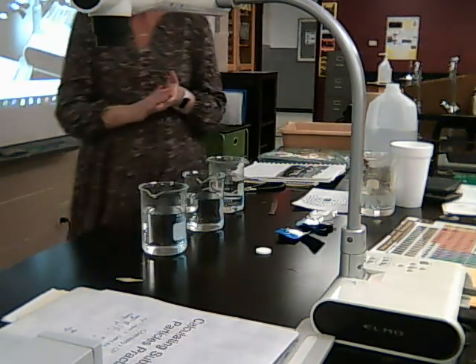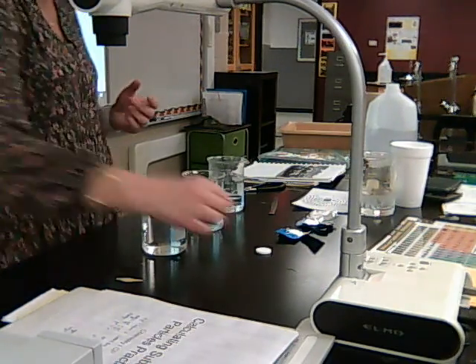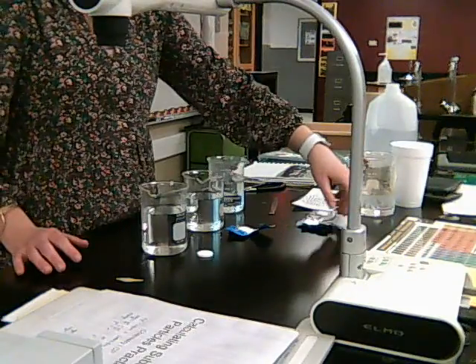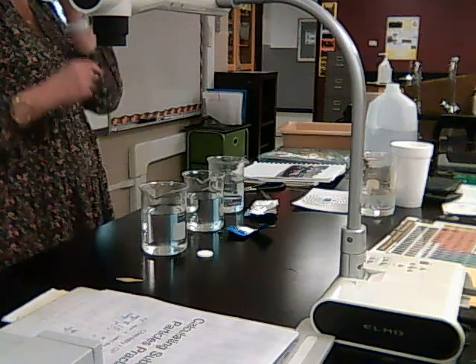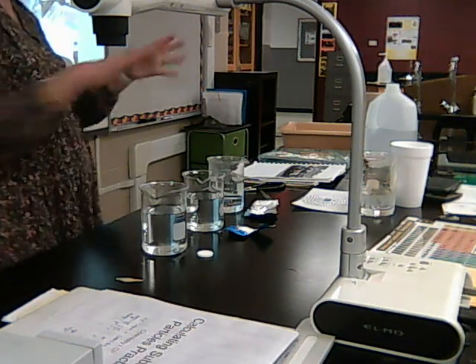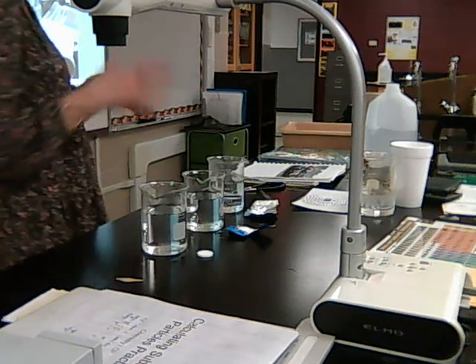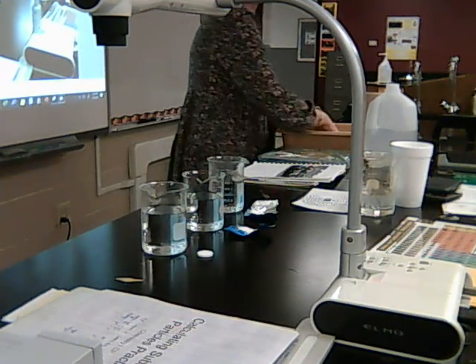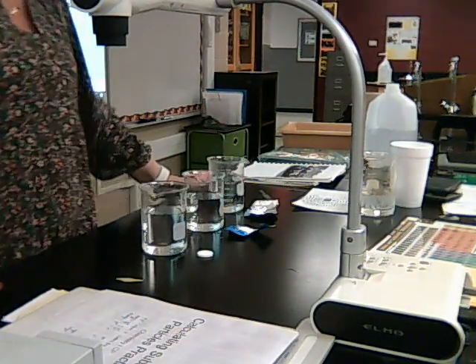All right. So now we're actually going to do our experiment. We're going to put the entire whole Alka Seltzer in one, the halves in another, and the crushed in another. And again, I'm not going to do all three of these at the same time because I won't be able to watch them all three at the same time. So how am I going to know how fast or slow they're reacting when I put them in there? What do I need to do? How do I measure how fast or slow they're reacting?